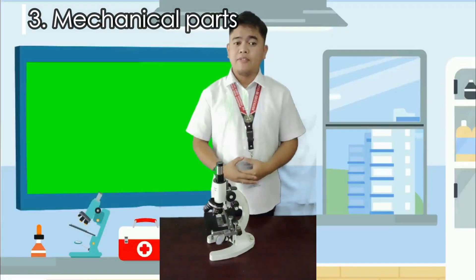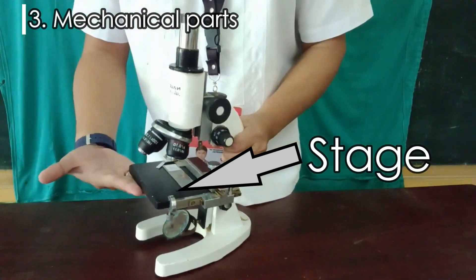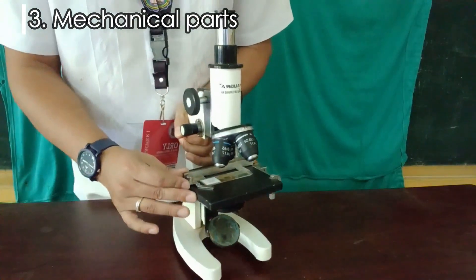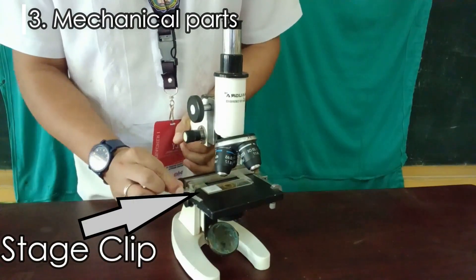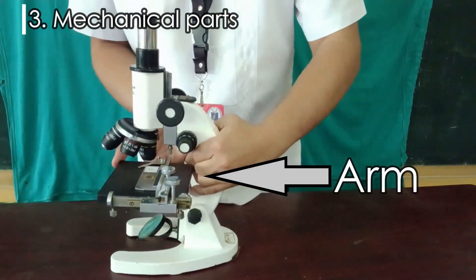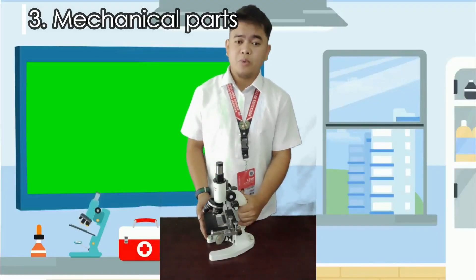The stage is a flat surface where the mounted slide is placed. The stage clip holds the glass slide in place. The arm is a curved shape that supports the body tube and is used for grasping and holding the microscope while transporting.